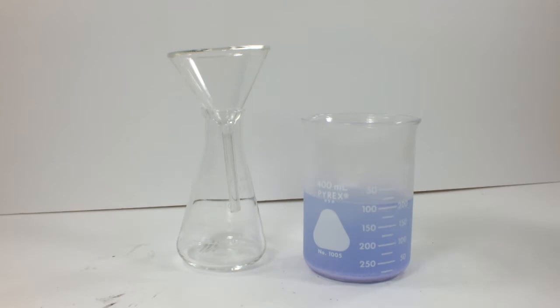I've got the chloride complex back out, and you can see the lavender color that I was hoping for. I hereby declare my creative synthesis a smashing success. We can't leave it at that though, so let's finish the workup by adding a ton more acetone.